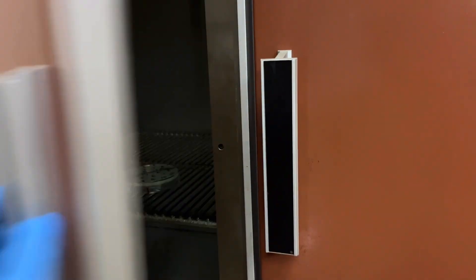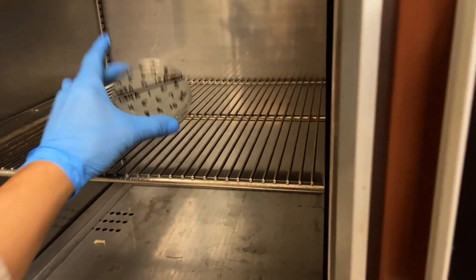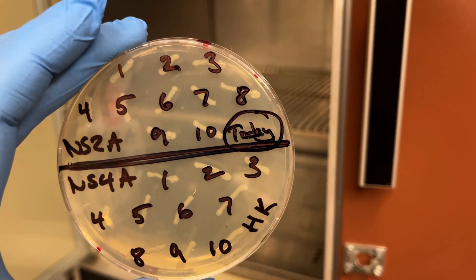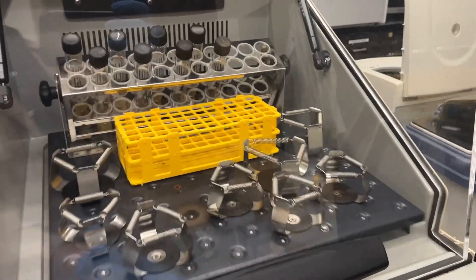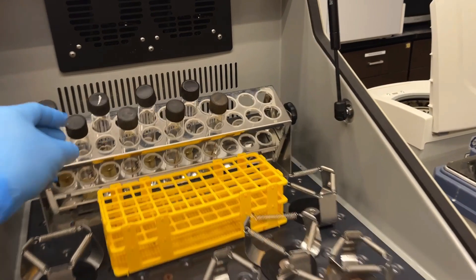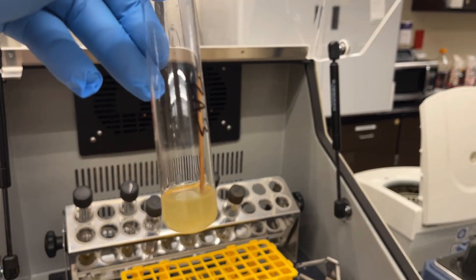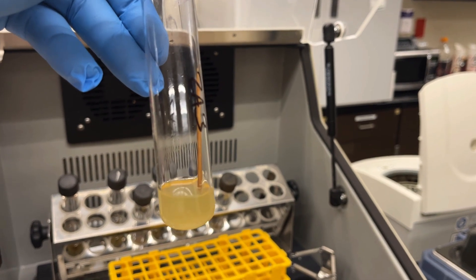And let's check on our plate the next morning. We should see growth along the lines that we made. And yay! Now we have ten clones of each that we can use for future plasmid preps if we need. And speaking of plasmid preps, what we'd like to see here is cloudiness or turbidity. And we do. And so this is now ready to isolate plasmid from.